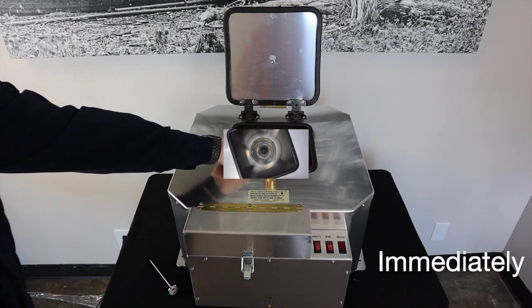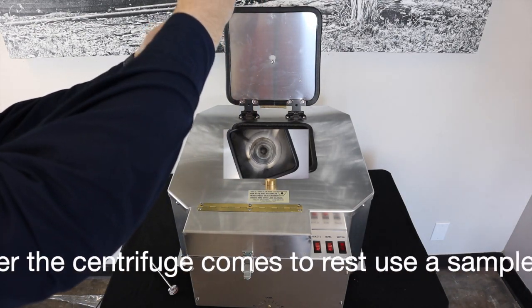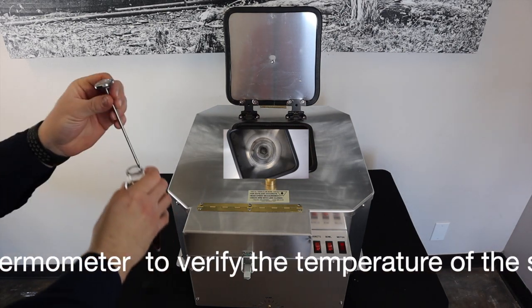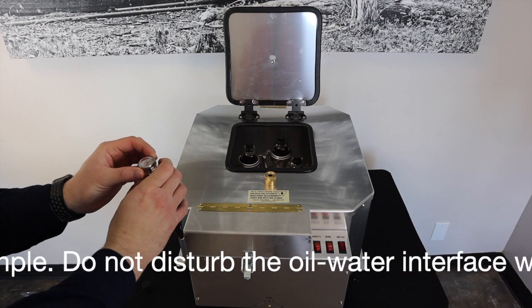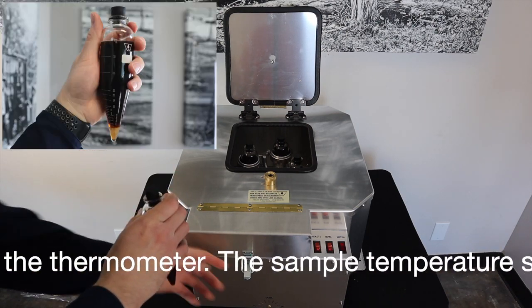When spinning has completely ceased, check the temperature of your samples to ensure the temperature has not fallen below the API's suggested amount. If needed, reheat the samples to a higher temperature than the first time and repeat the process.